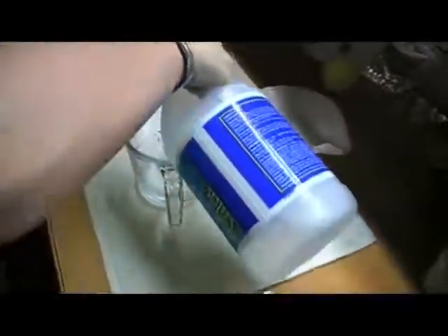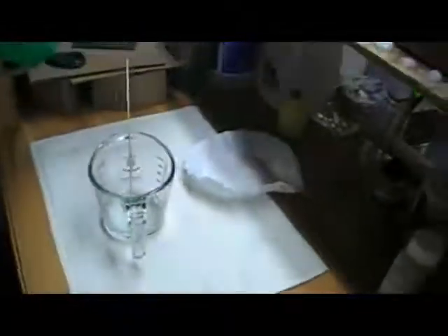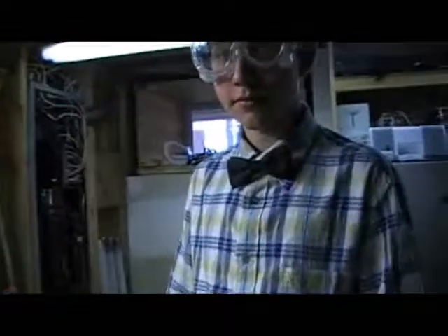Can I try this ammonia? Sure, I guess it won't hurt anything. Okay. Wow. Your science stuff is exciting. Well, what did that do? I don't know. That's another thing I read. You should not conduct unauthorized experiments. Oh, yeah. Especially if you do not know what the substances are. You're right.